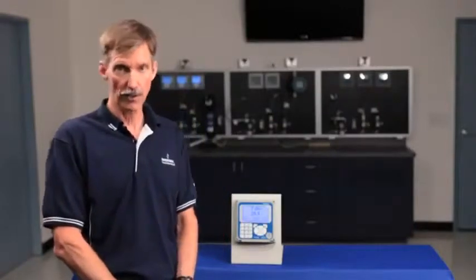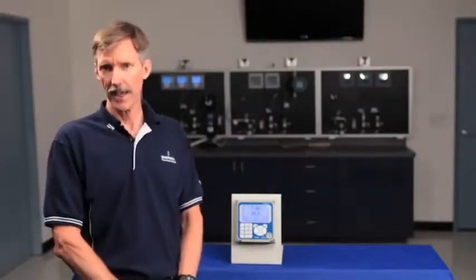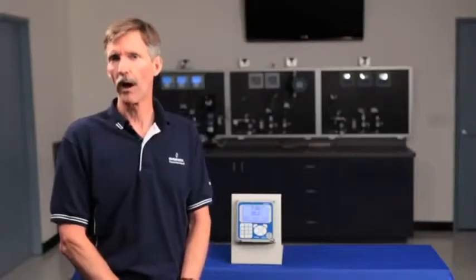Let's talk about three aspects of commissioning, which are initial configuration, the mechanical installation, and wiring of the sensors.